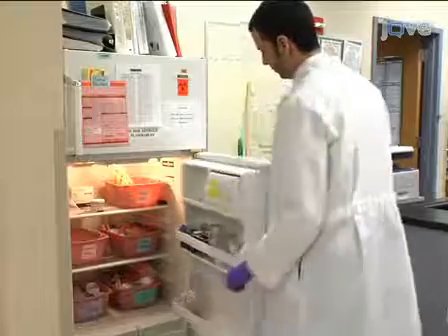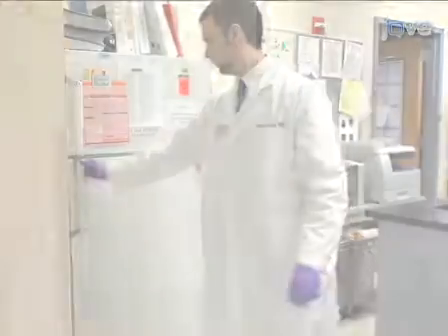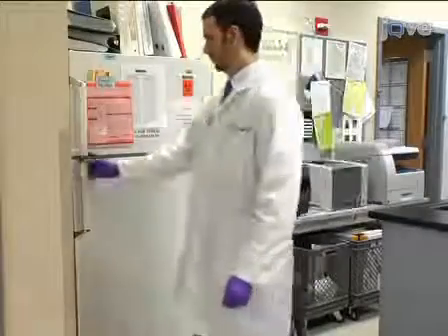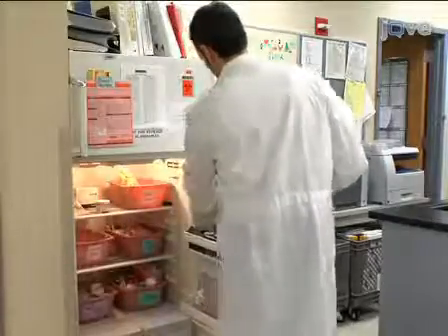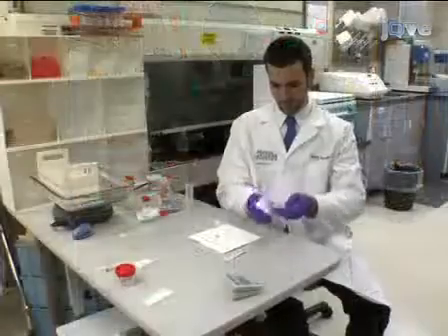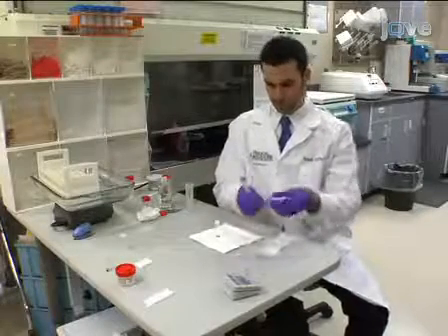At the end of 15 minutes, proceed to remove the gel containing the cells from the glass tube. To dislodge the solidified histogel disk, which contains a layer of concentrated specimen at the bottom along with the dark colored AV marker, use a 23 gauge needle attached to a syringe filled with 10% formalin.